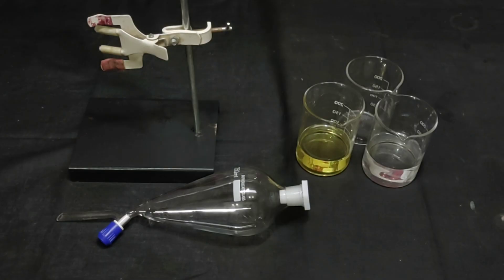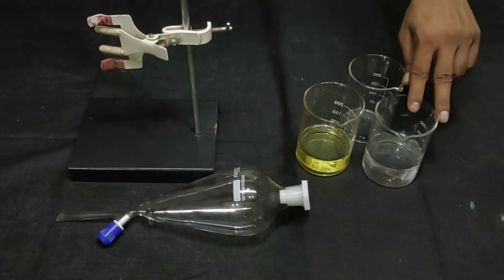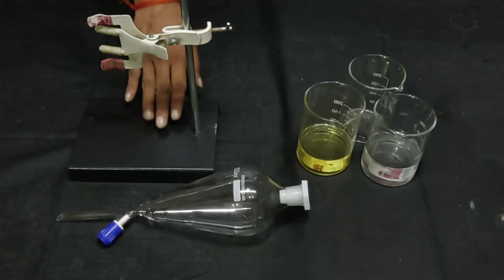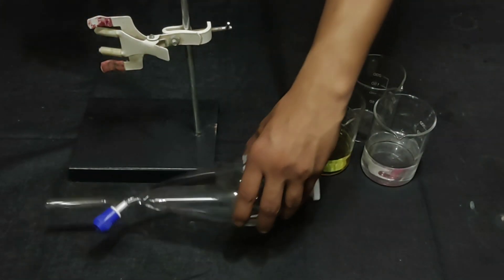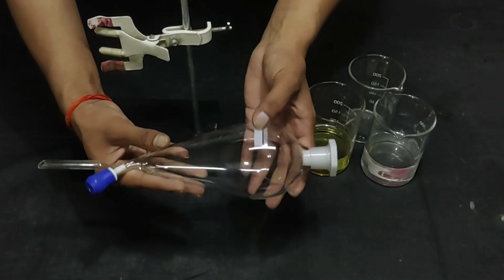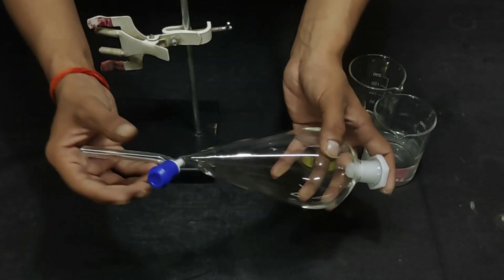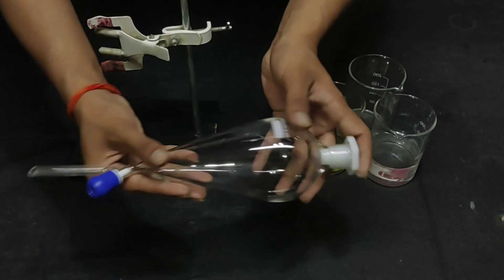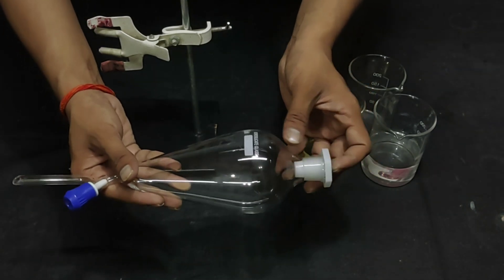Materials required for this activity: a beaker, water, oil, a stand with clamp, and a separating funnel. A separating funnel is a double-mouthed flask which is fitted with a stopcock at one end and a cork at the other end.